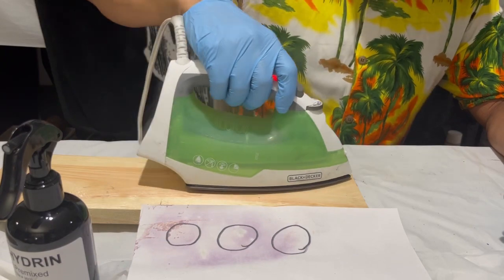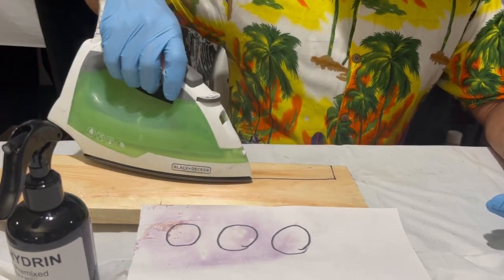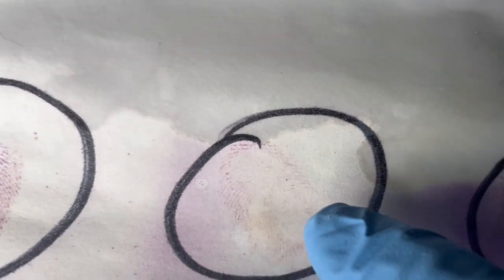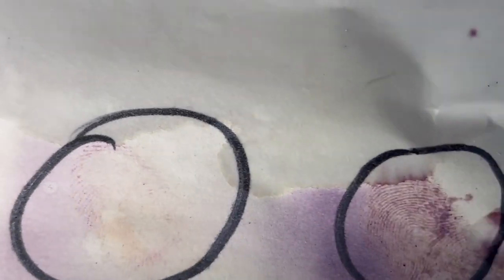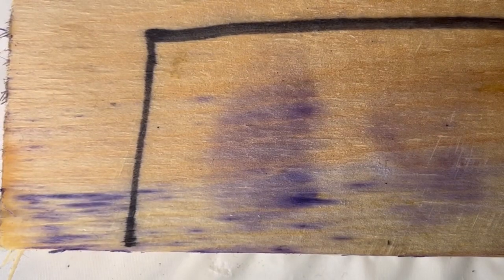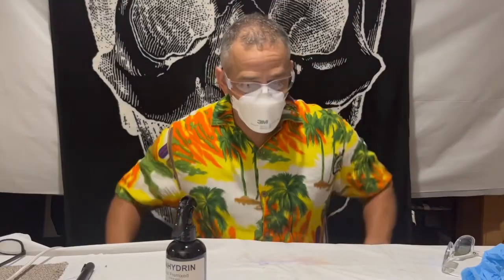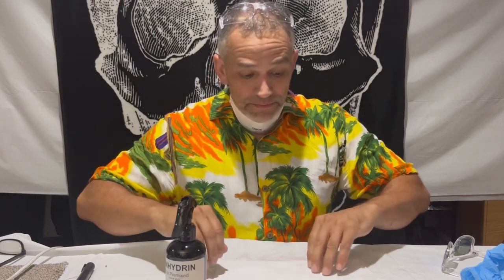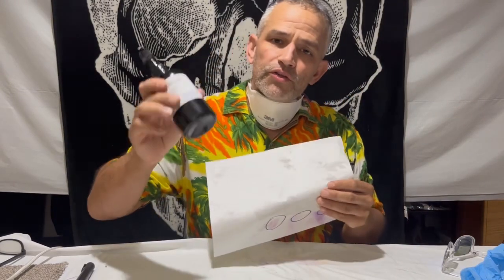I'm doing the same on the wood just as I did on the paper. Here's our first print, the second one a little bit on the top here, and then our third print. We didn't have as much success with the wood — we can see where the fingerprints were but there's no detail. And that is how we develop fingerprints on paper using ninhydrin.